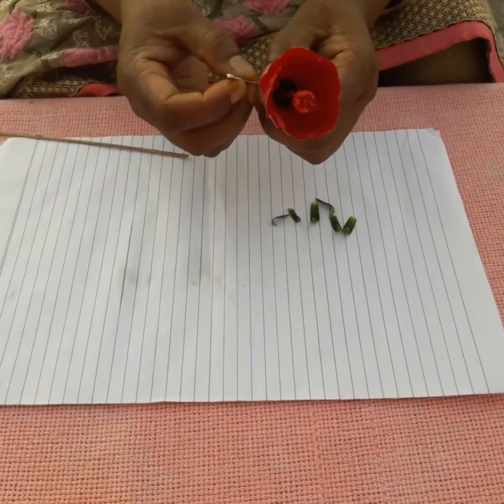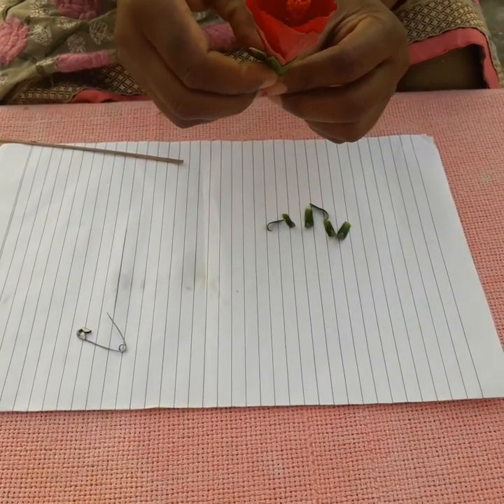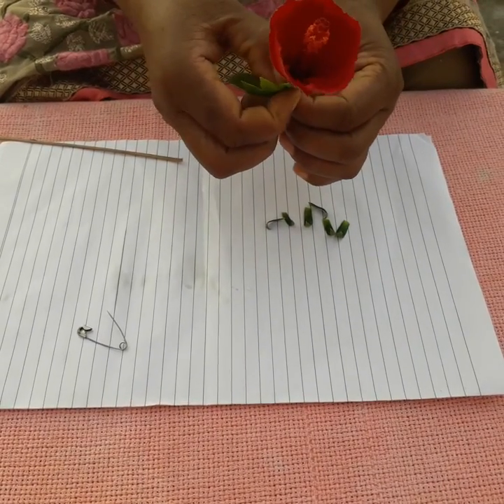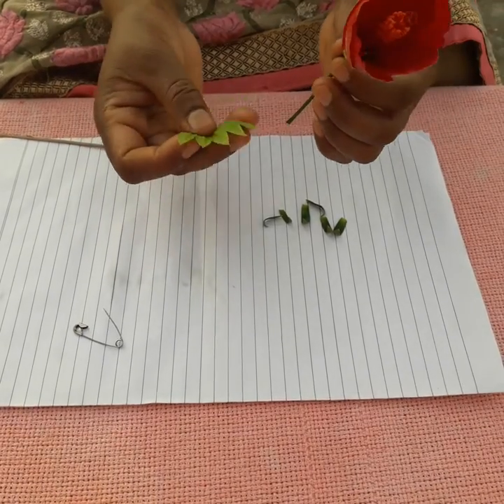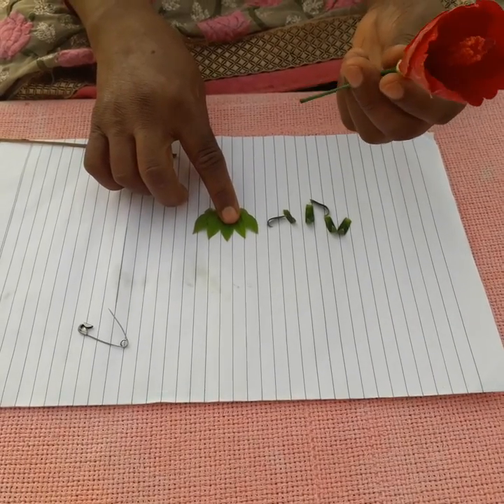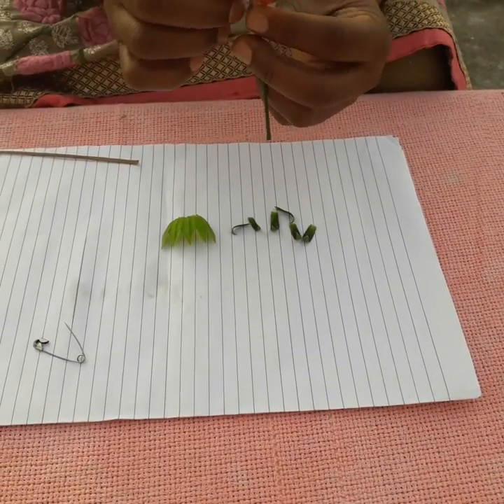Here you can see the sepals, collectively known as calyx. I am taking out this sepal — the green part. This is known as calyx. This is the first whorl of the flower. Collectively it is known as calyx.